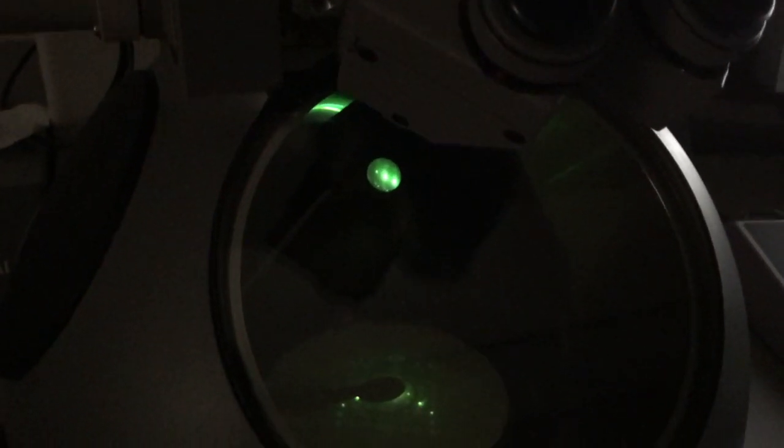So this is a little tricky to do here, so I'm going to do this using the binoculars and the focusing screen, because that's usually the most accurate method to do it. Okay, so I've inserted objective aperture 4, and you're seeing the image of it right now on the focusing screen, and clearly I don't have that around the direct beam, so I'm adjusting my aperture shifting knobs, I should say, until I'm centered around the direct beam.